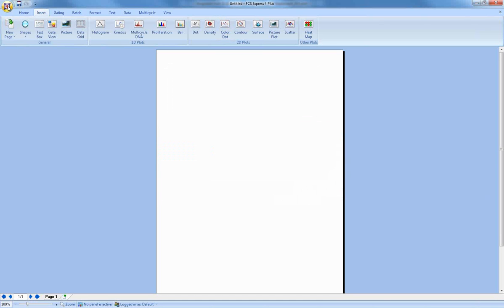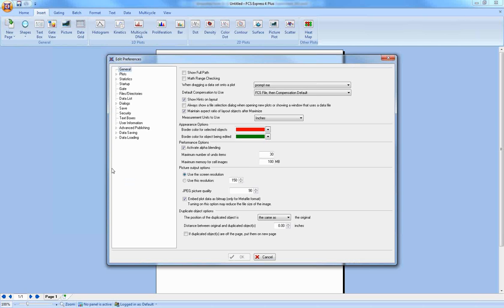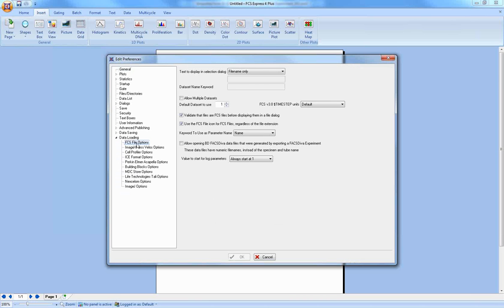Now you can change that. If for some reason you don't have access to your original DIVA experiment, or you know that the data and the parameters you're looking at are okay, you can come into the preferences under the application button, edit preferences, and then go under data loading and FCS files. You can see that we have a specific option for allow opening FACSDiva data files that were generated by exporting an experiment.